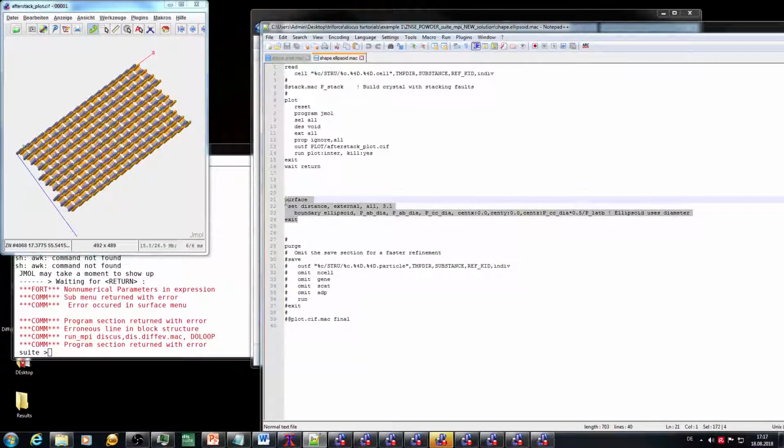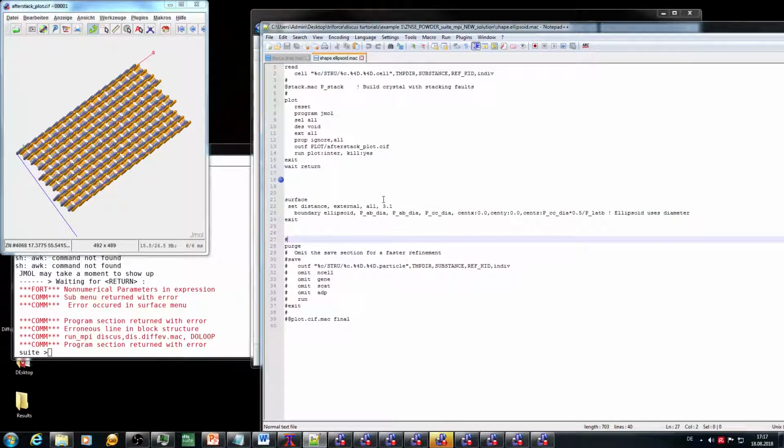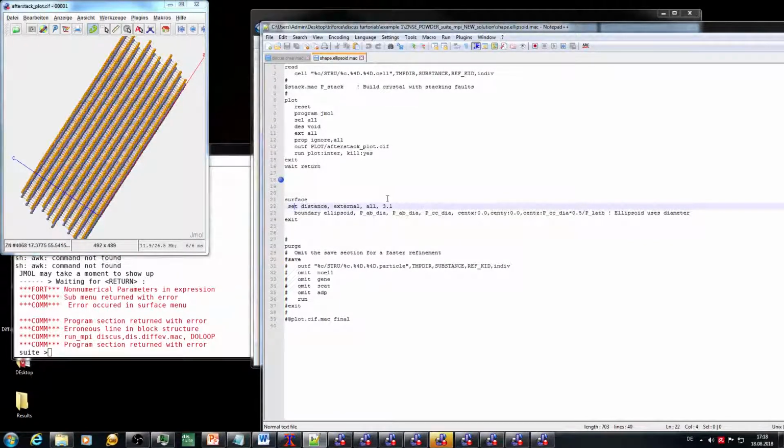But then we have the error occurring in the surface menu, which is already teasered here. And then a lot of commands are commented out, so they are not of any use. That means in these few lines, there has to be an error. When we look at it, we see the set distance external all. It's pretty much defining atom properties around 3.1 angstrom out of an external surface. That's okay in general. Boundary ellipsoid, diameter, and the center of the ellipsoid. We are talking about a sphere today, so all these parameters should be identical, because we set it identical in the beginning. And then we put in the center of the sphere, in the center of this stacked crystal. So in general, this looks pretty fine. From the number of commands, it's totally okay. So some of the parameters need to be corrupt.